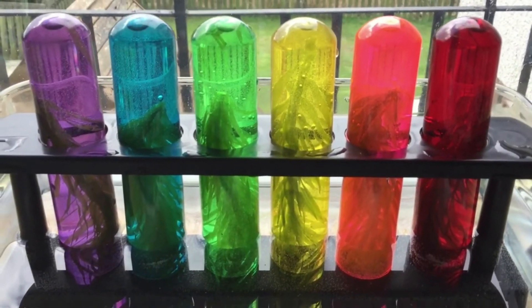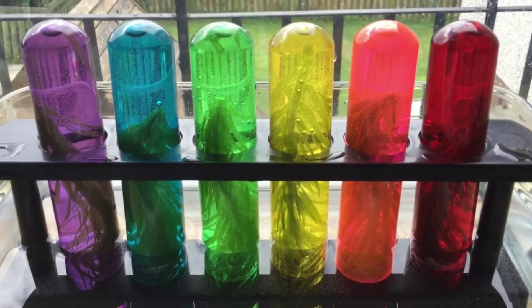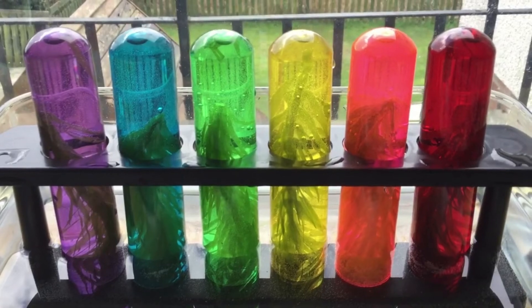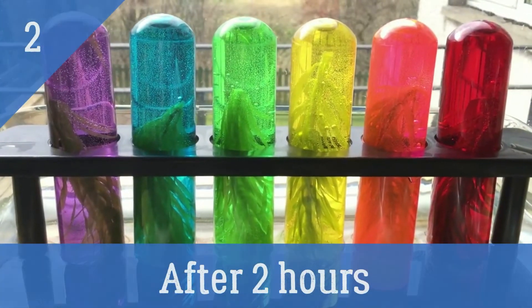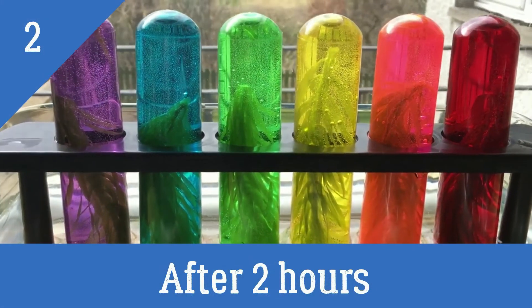We'll come back in another hour's time. After two hours, the sun has come out again.